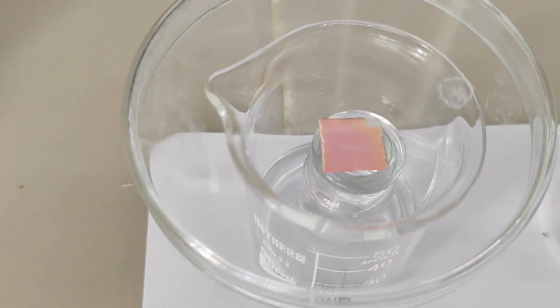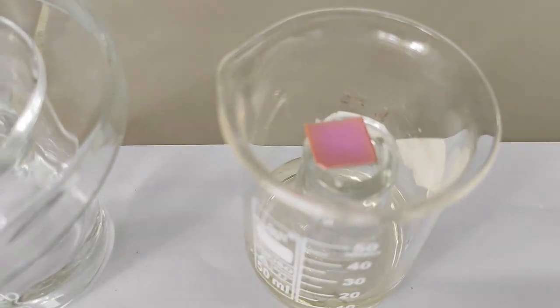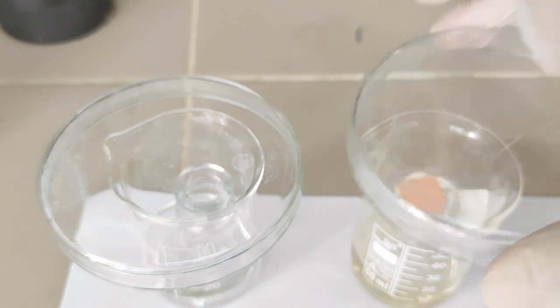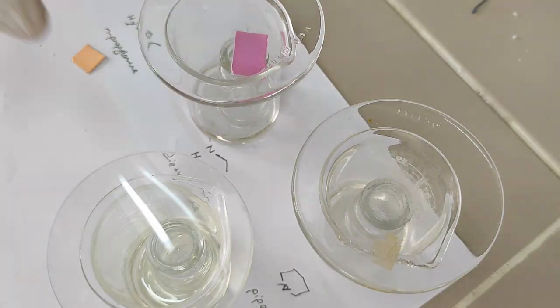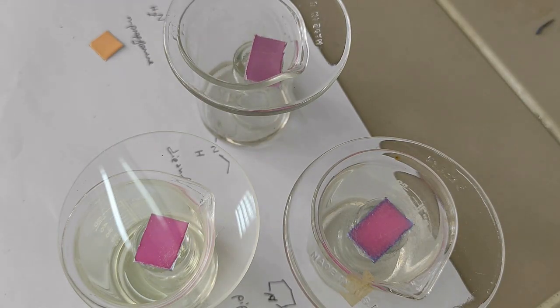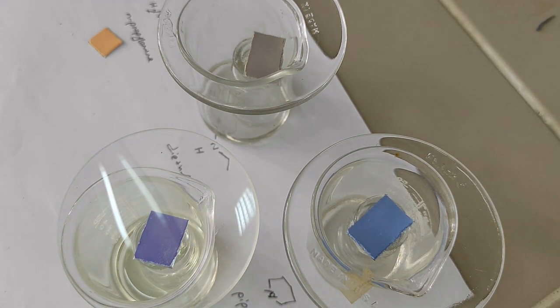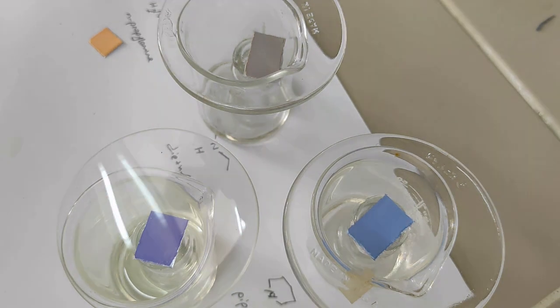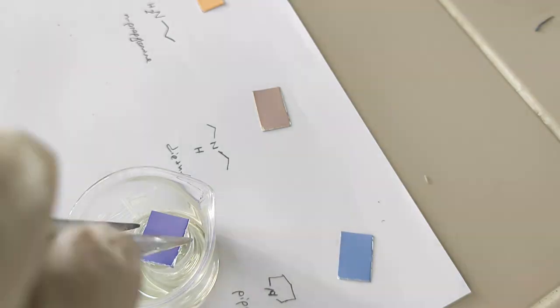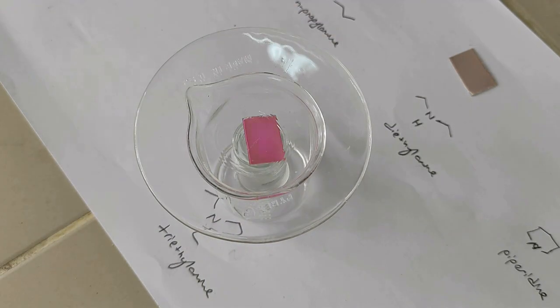For primary amines, I use ammonia and propylamine. For secondary amines, I use diethylamine, piperidine, and morpholine. The clearest differentiation among the same class of amines is observed with secondary amines. That is, variations such as cyclic structures and heteroatoms in auxochromes influence photophysical properties. For tertiary amines, I add triethylamine.